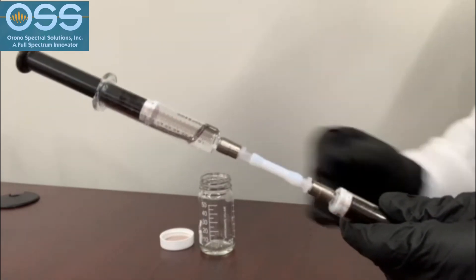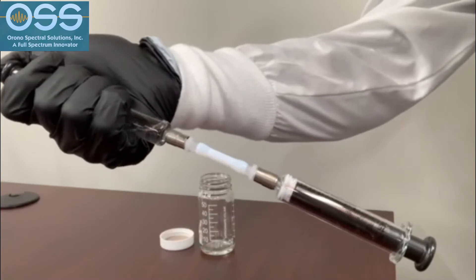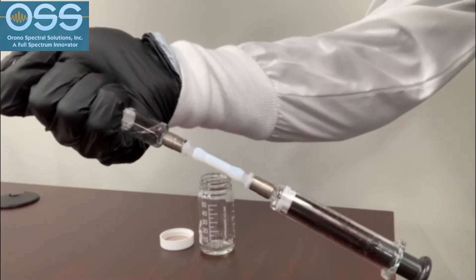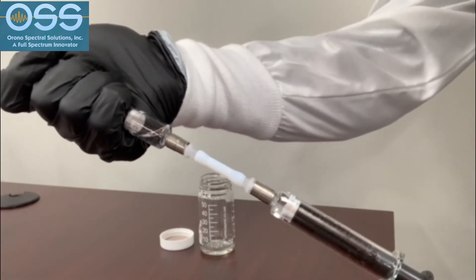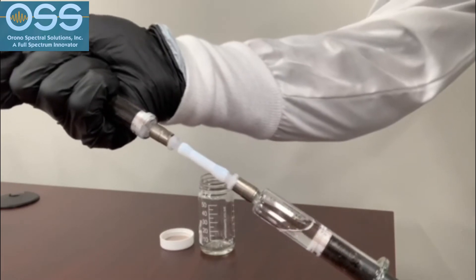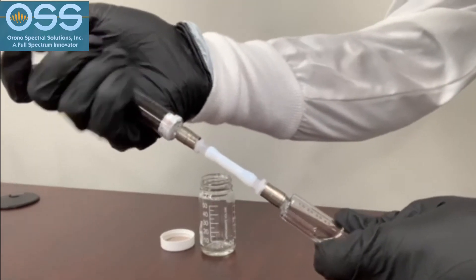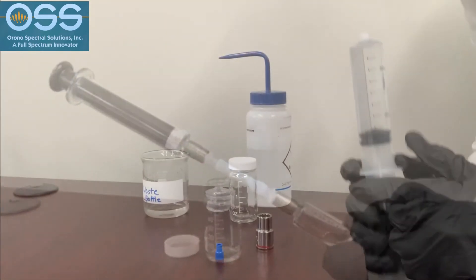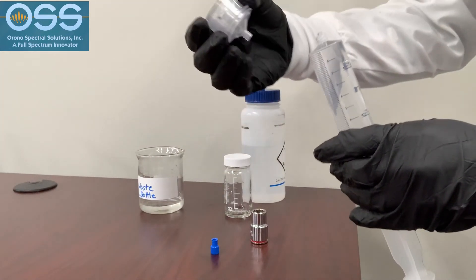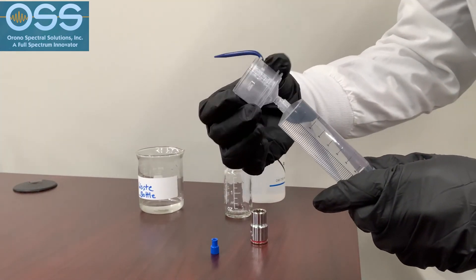The remaining solvent or nonpolar liquid will be air dried and reconstituted using a small amount of acetone and water. All of the water and nonpolar component mix is then put into a syringe.